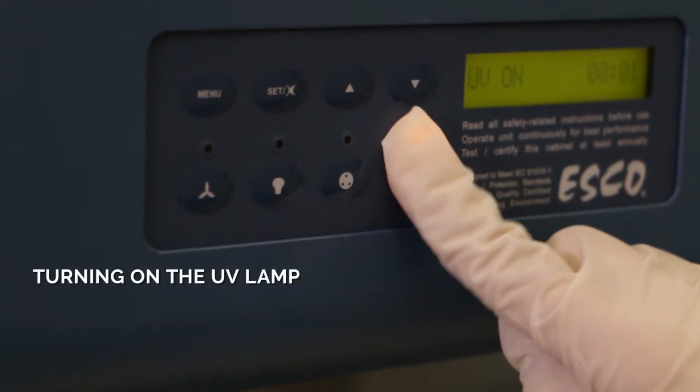Turn on the UV lamp, when present, to decontaminate the work area by pressing the UV button. The UV lamp can only be turned on after the post-purge procedure is finished. Leave the UV lamp on to make sure the decontamination is done effectively. This can easily be done by setting the UV timer.